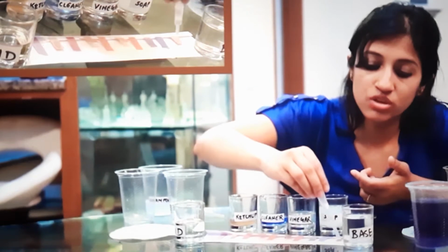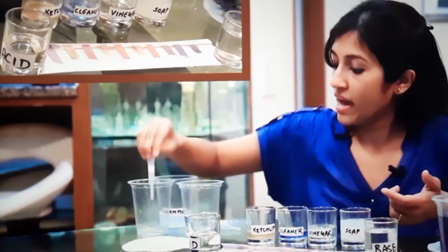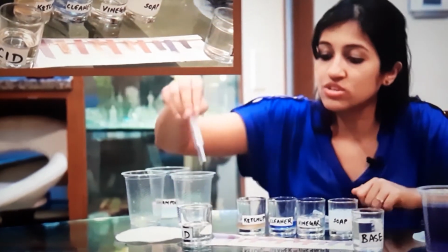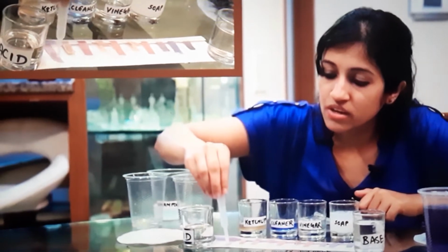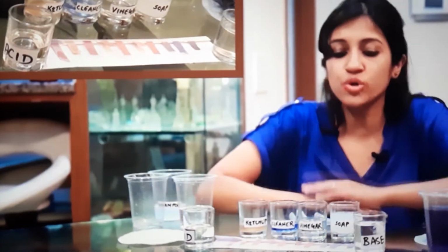A very strong base should turn red litmus blue. So this is a very strong base. Let's see what happens. Oh wow, it does happen in a beautiful way. Can you see that? And for a very strong acid, normally you cannot use plastic with acid, so I'm going to do it really quickly so you can see it. Just take a little drop. You saw how it reacted? You should ideally not use plastic with an acid, but I just did that to quickly show you guys.